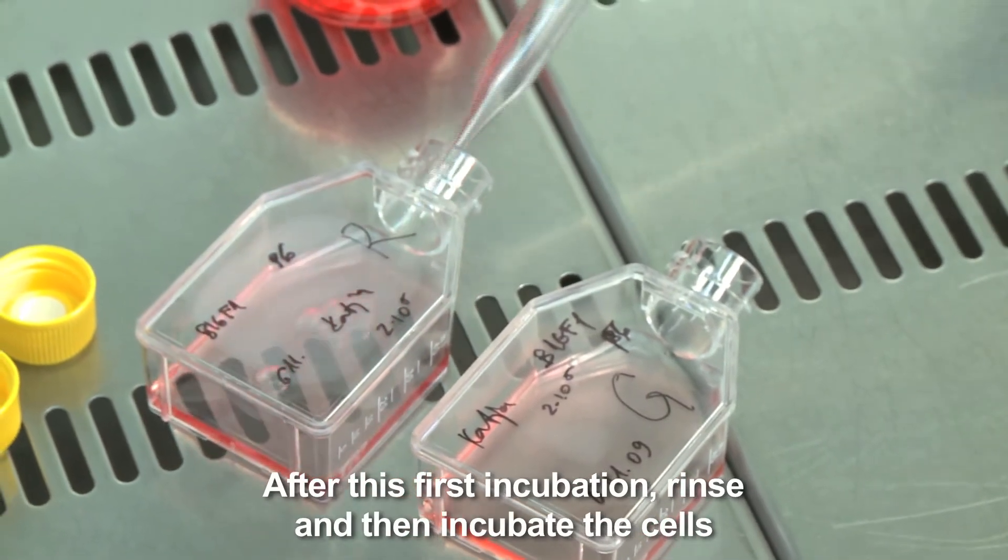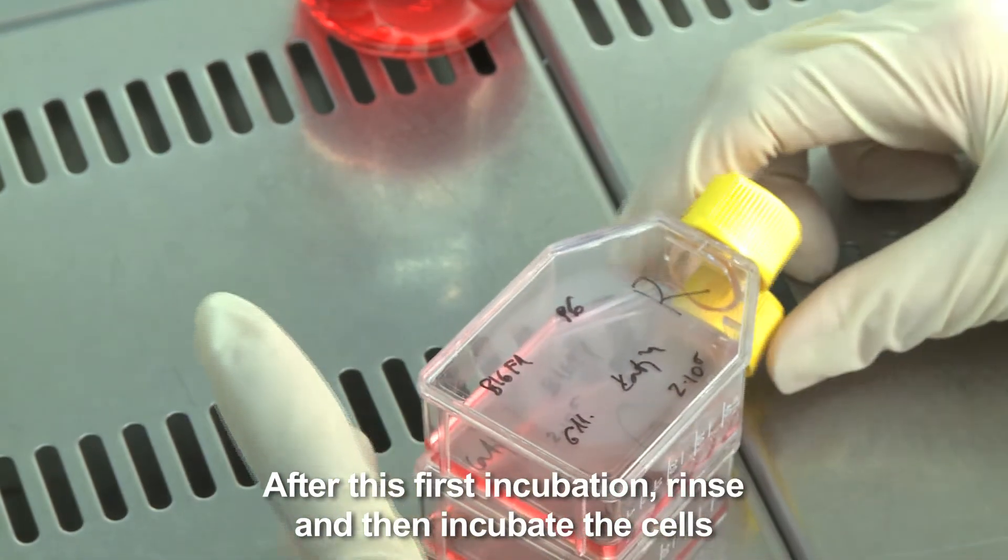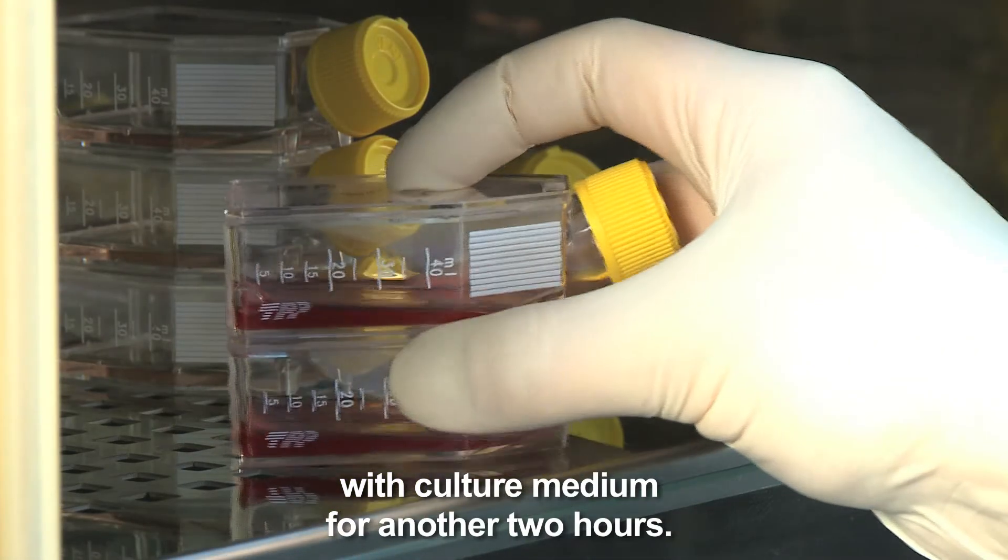After this first incubation, rinse and then incubate the cells with culture medium for another two hours.